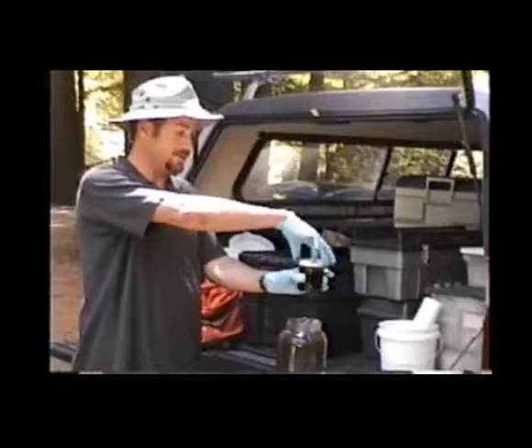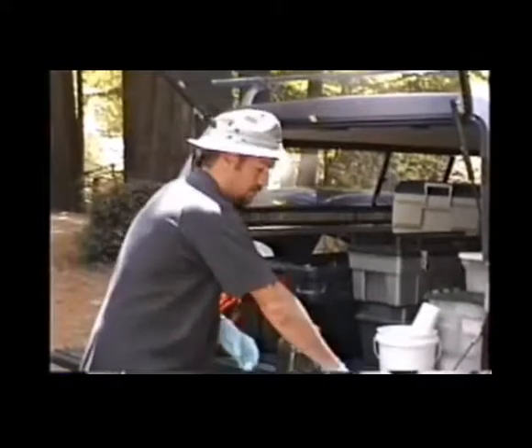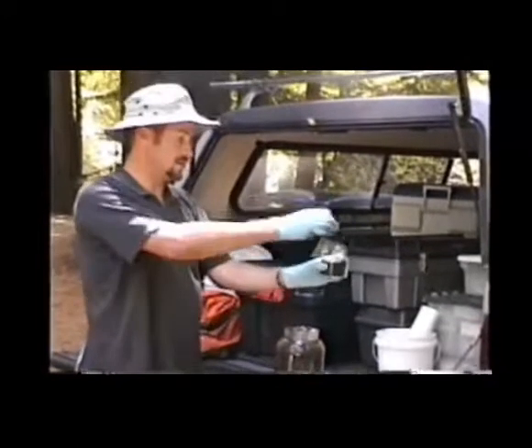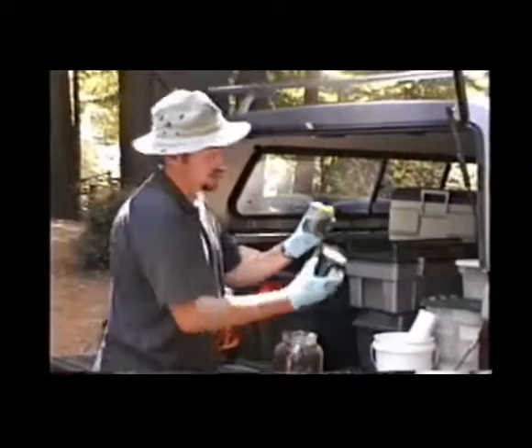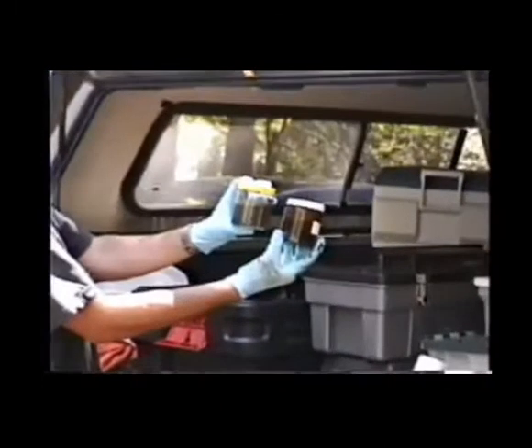Put the cap back on. This one looks good also. Put the cap back on. We want to inspect each jar, making sure that they look homogeneous and equal to each other. These look pretty good. Samples go on ice. Homogenization and aliquoting is complete.